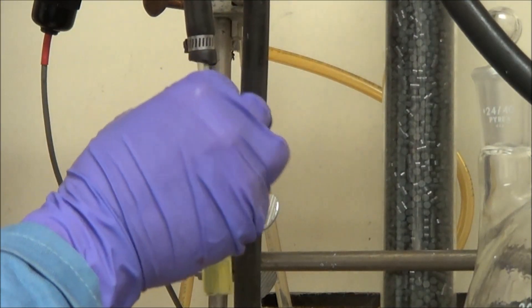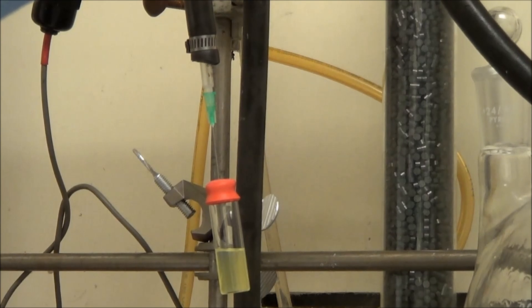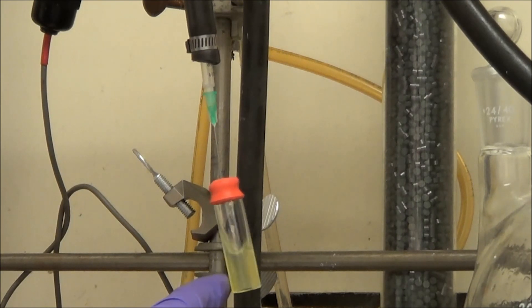So here we're going to pull off the solvent. This part locks the polymer, the amphiphilic polymer, the octylamine groups, with the quantum dot ligands that are also hydrophobic. So this is essential for forming a micelle that allows the dots to become soluble in water.